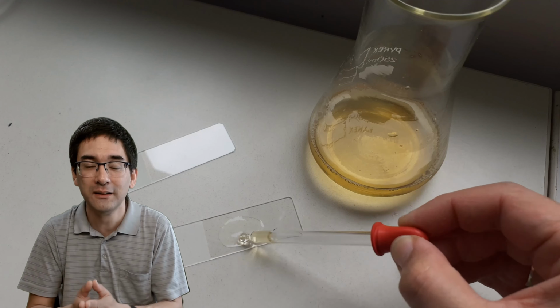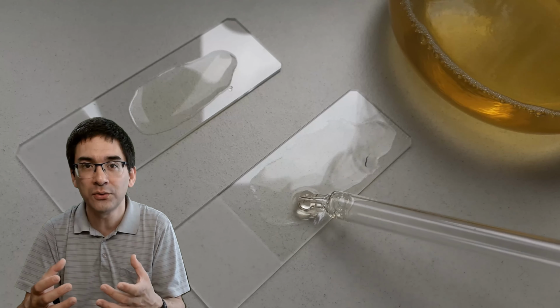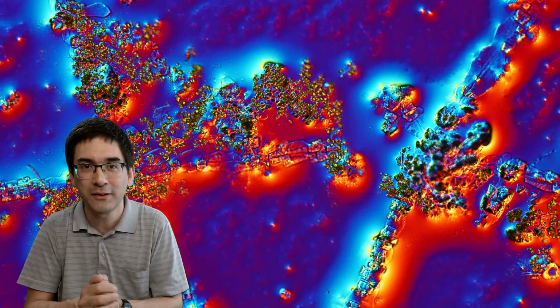Yeah, and here I'm just showing you what I've done. I've simply applied a little bit of urine on a microscope slide. One slight problem: when the urine dries out, the drop might contract a little bit and pull together. So you have to make sure that it's always a little bit spread apart, so that you get a nice thin layer of urine and then of crystals on the microscope slide.